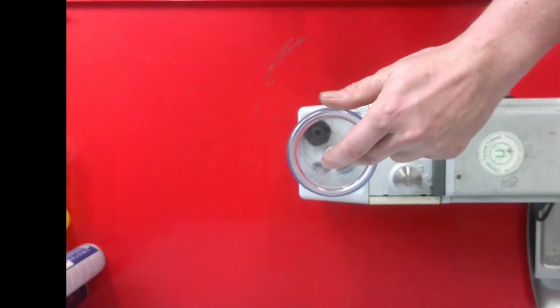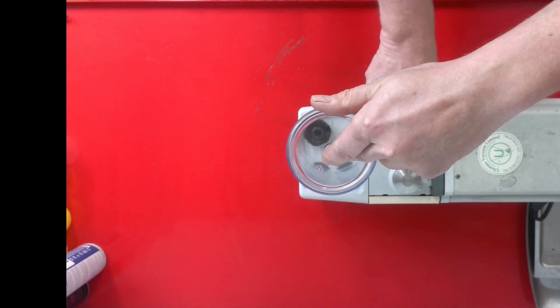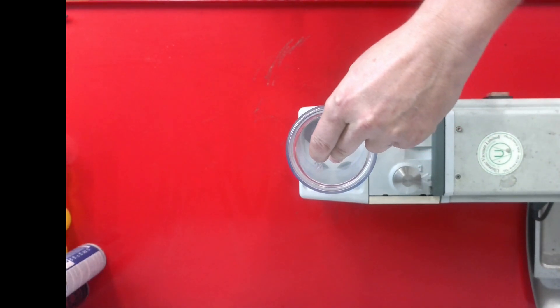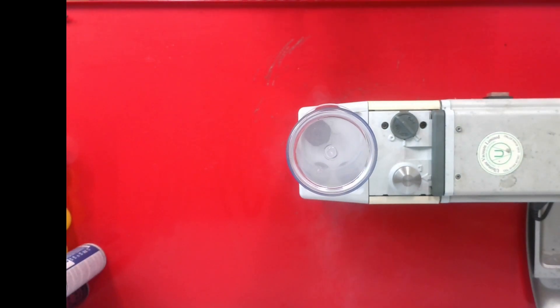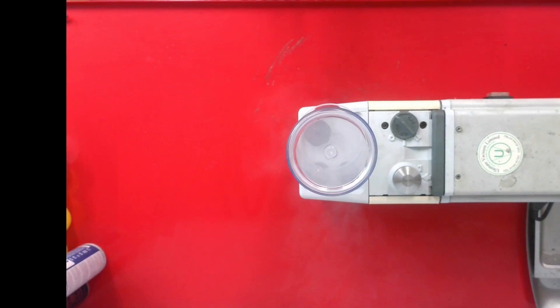And as you can see, in this case the gas ballast is employed. A large amount of air is now flowing through the pump, and it's bringing these oil particles out as a mist in the exhaust.